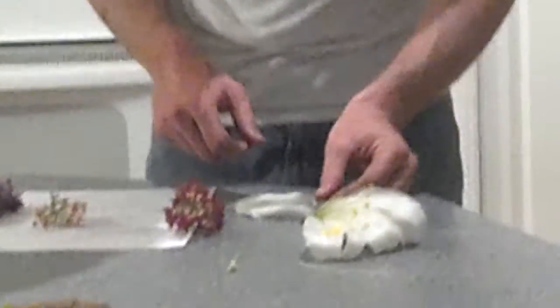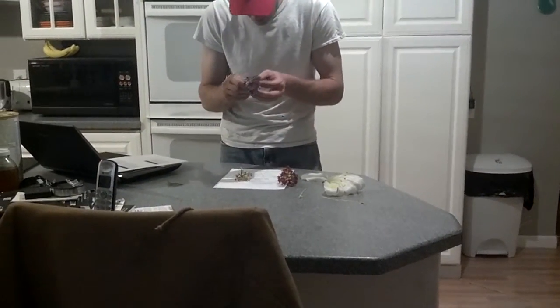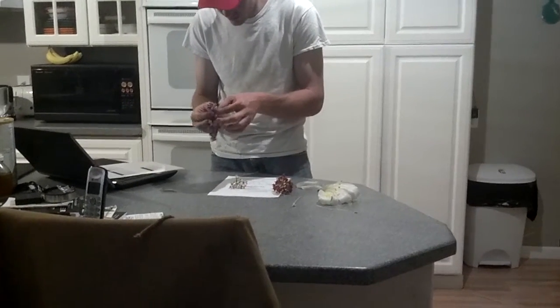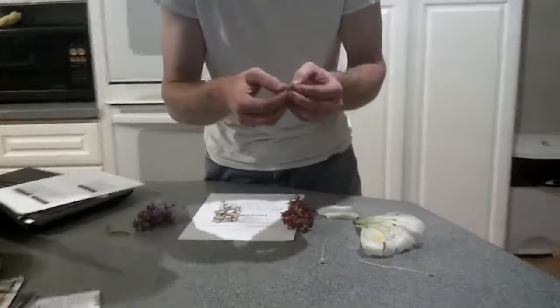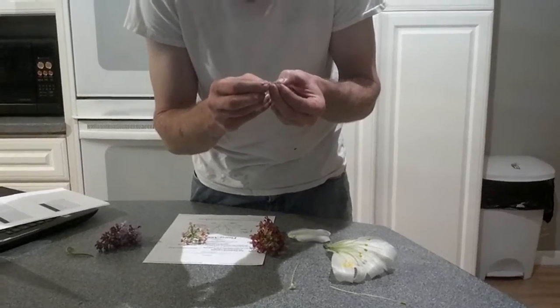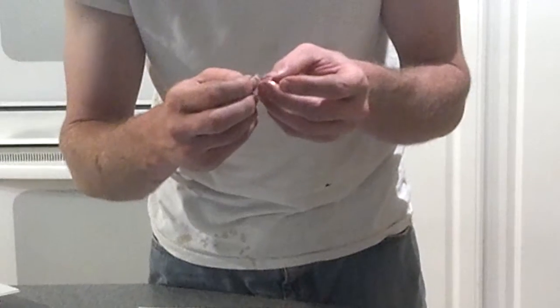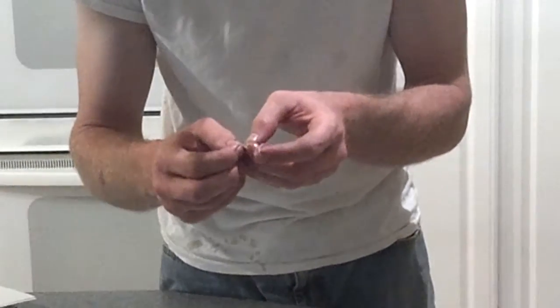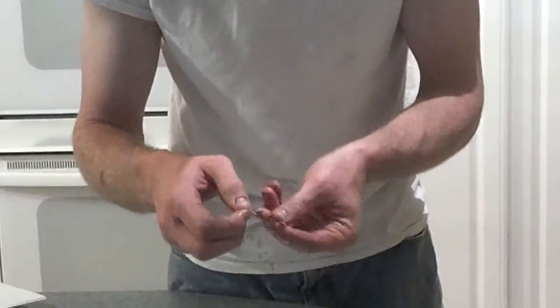So that's on the Easter lily. On these other flowers, you'd be able to find pretty much the same thing. I can pull this lilac. This lilac is very well scented. You can really smell it. If we pull this apart, it would probably be difficult to see, but you can still see the yellow pollen on the anther, top of the stamen there. All the way down, you will have the stigma on top of the style going down to the ovary as well.